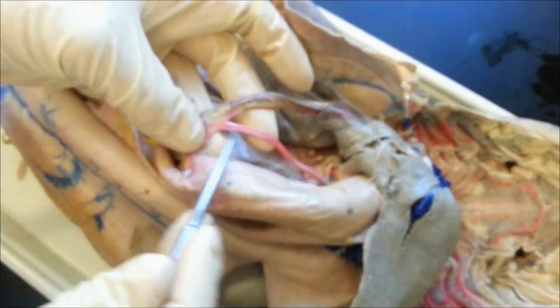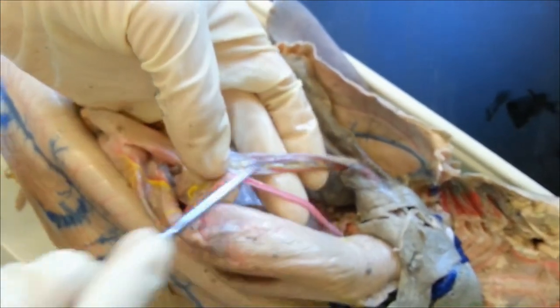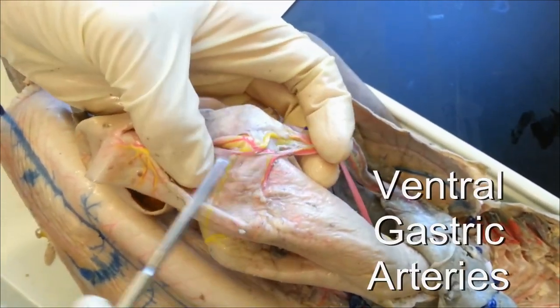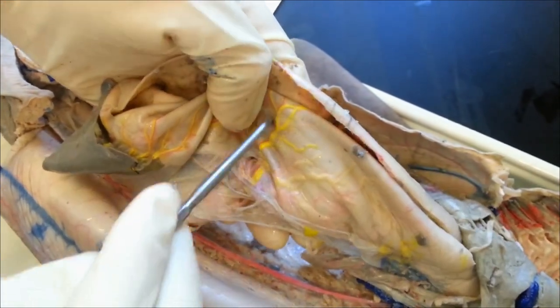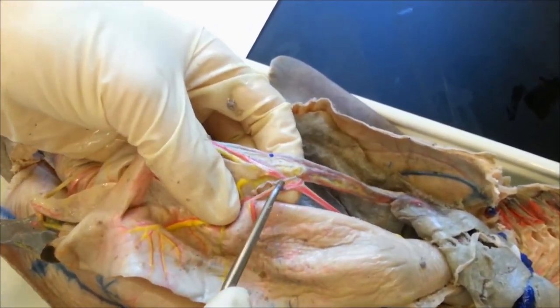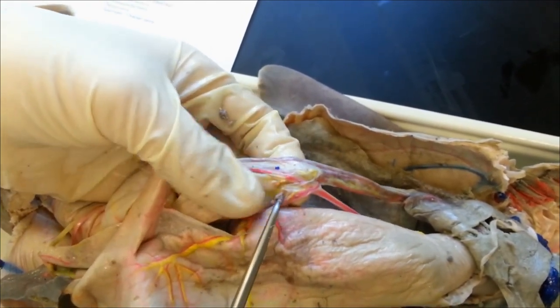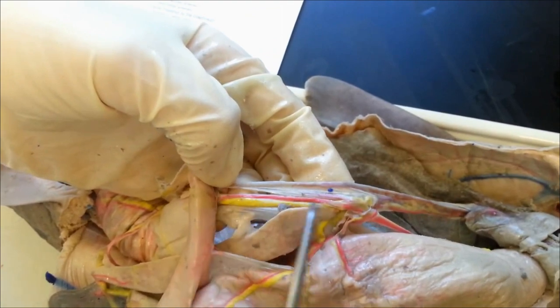The celiac artery crosses the hepatic artery here, so they kind of make an X. The lower half of the X has the gastric artery going to the stomach, and that splits into ventral gastric arteries and dorsal gastric arteries — you have to flip it around to see the other side. The other part of the X, after the gastric artery, is the pancreaticomesenteric artery, which is going towards the pancreas.